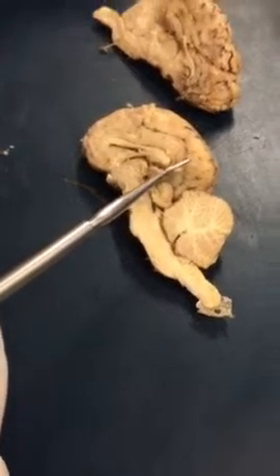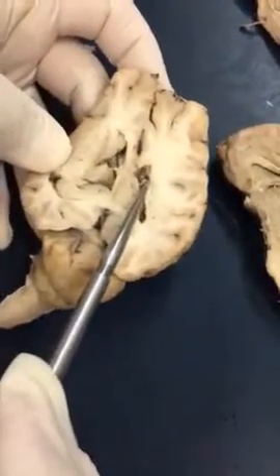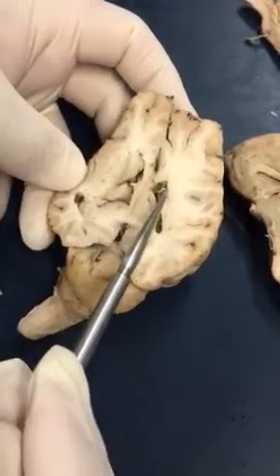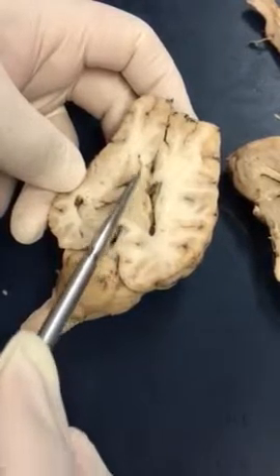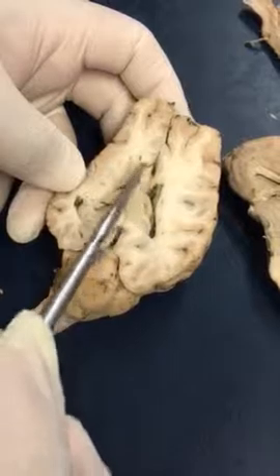That's it for that part. On this view, you actually see the lateral ventricles fairly clearly. You see the thalamus here as well, which is that gray matter that you're seeing there. And then you see the corpus callosum right here. And here you do get a good view of that septum pellucidum, separating those two ventricles.